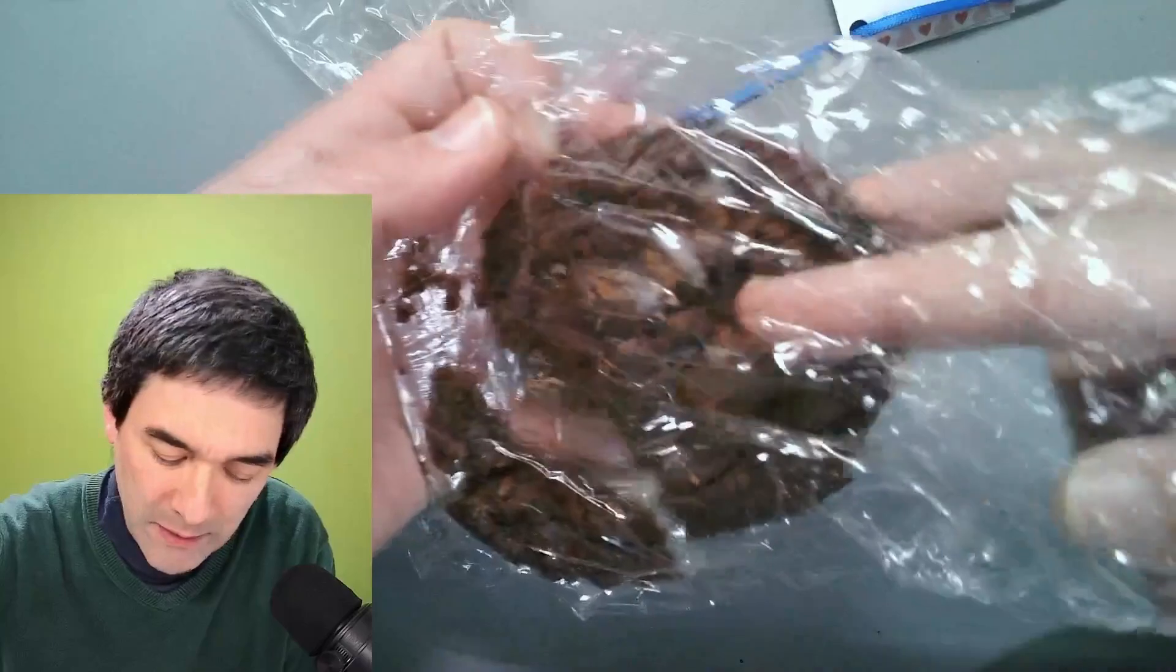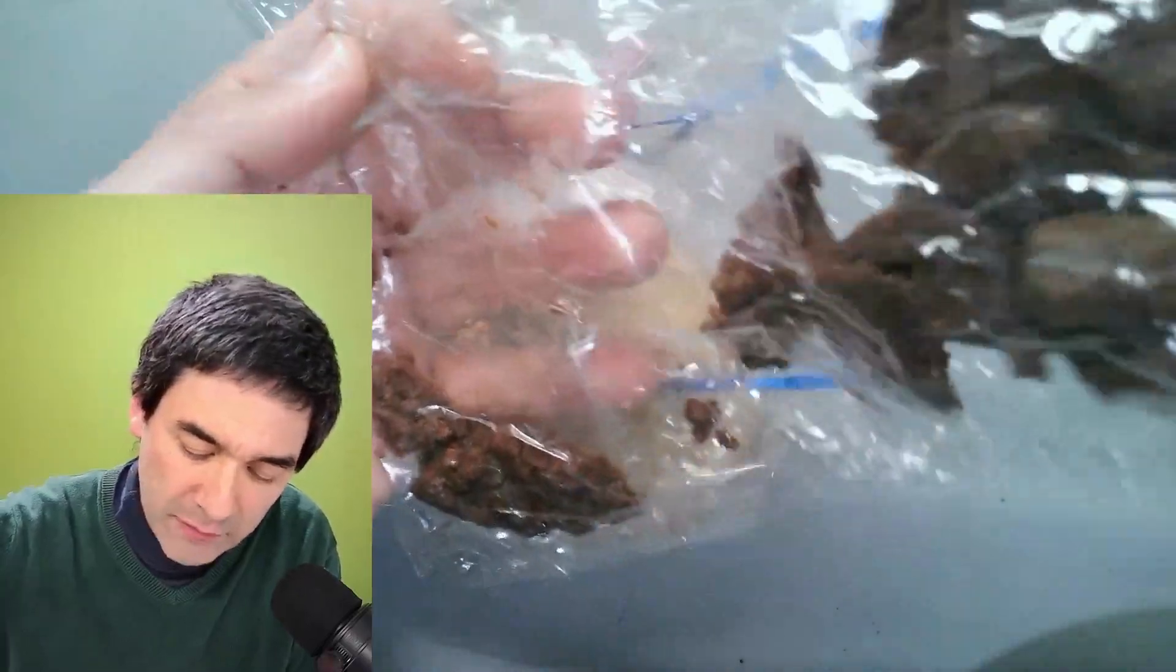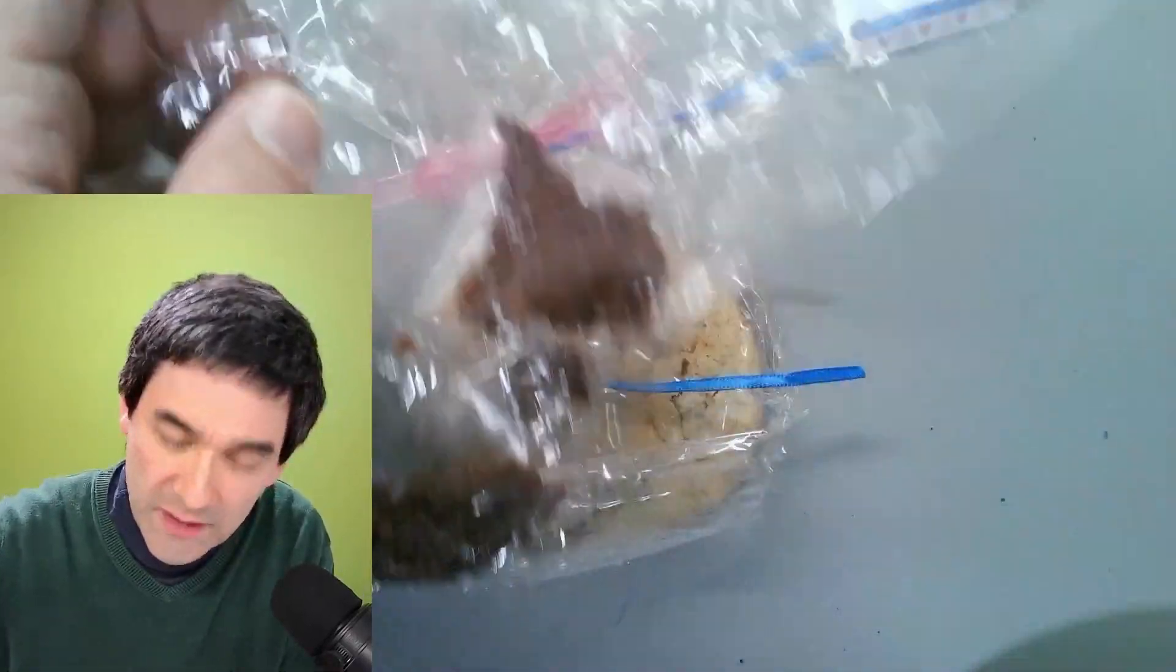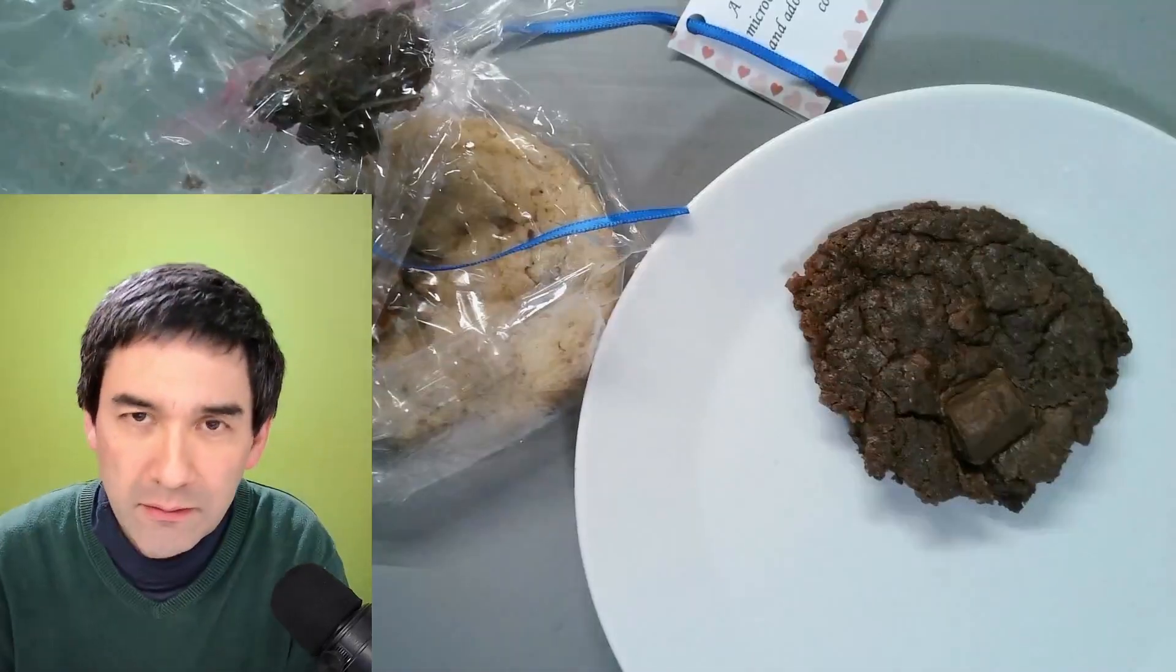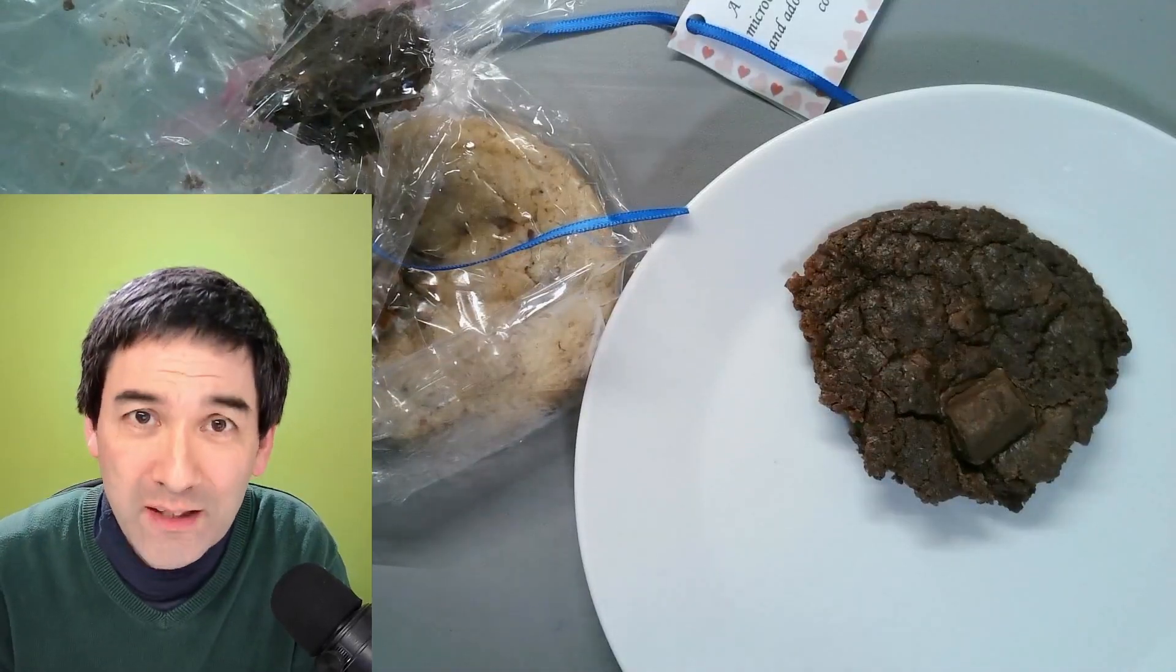Oh, it's a little bit fragile. Okay, it doesn't matter. I'm going to leave the rest in here. That's a really nice chocolate cookie. Let's put it under the microscope first and have a look.